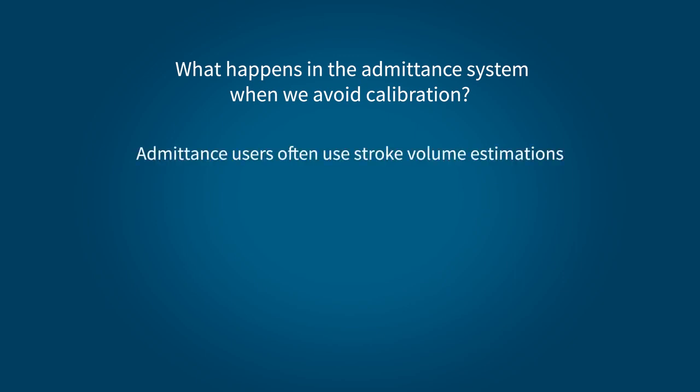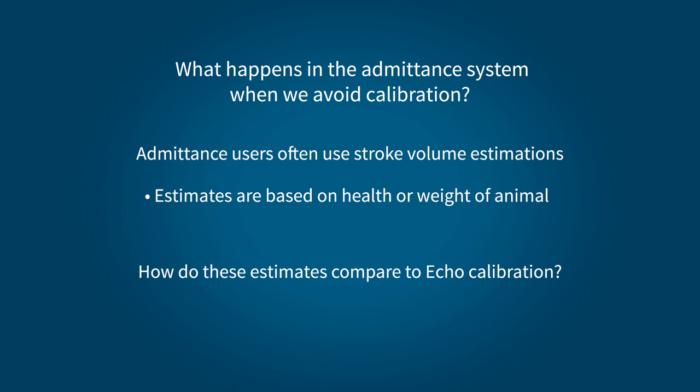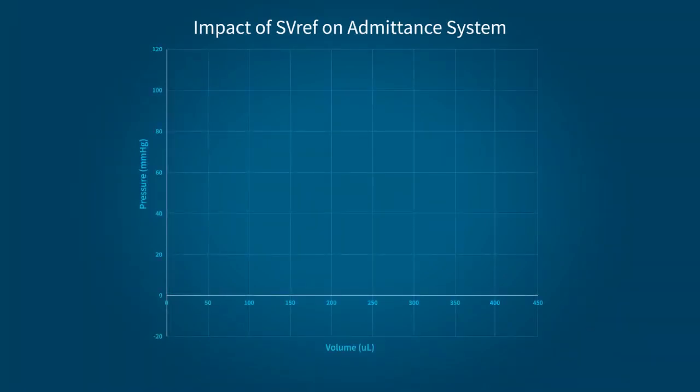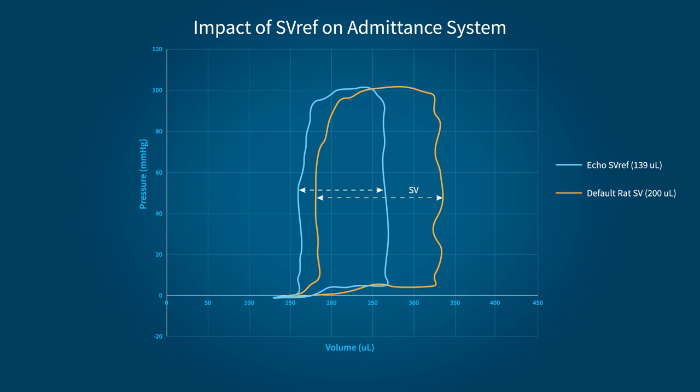Admittance users often use the stroke volume estimations that are provided with the admittance system. These estimates are based on the health, or in some cases, the weight of the animal. In this example, we compared these suggested estimations to an ideally calibrated admittance system using echo. Let's look at the PV loop data from just one rat. Here, the volume signal is calibrated using the default 200 microliter stroke volume estimate for a healthy rat. When we compare this to the ideal calibration using echo, here, we can clearly see there's a large difference in stroke volume for that same rat. When we use the other suggested estimate, based on the weight of the animal, here, we get an even greater difference in the stroke volume.